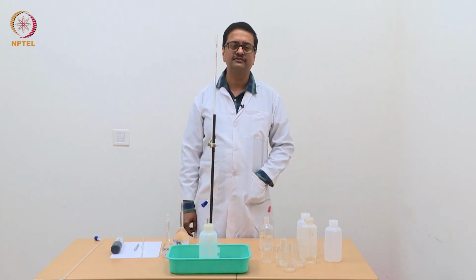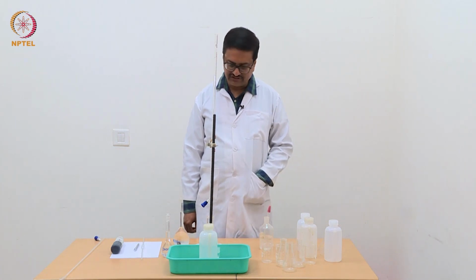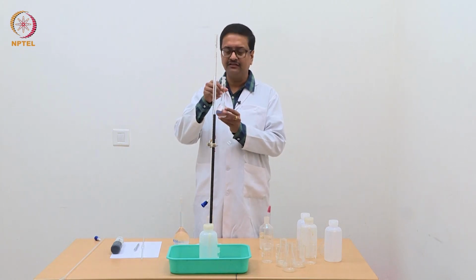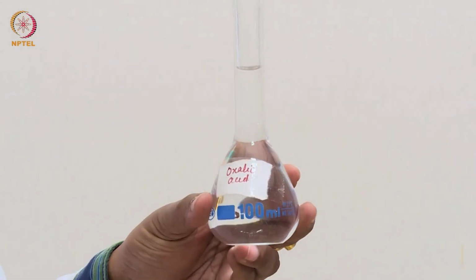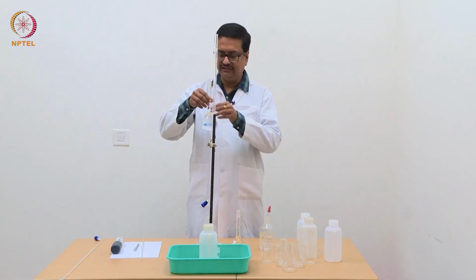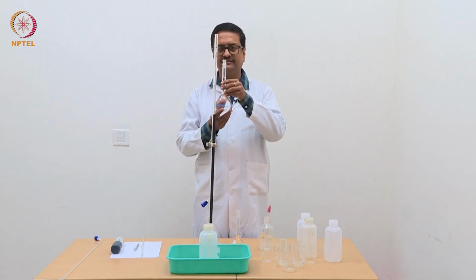In this video we have shown you how to prepare a primary standard solution of oxalic acid, which I am going to use in this experiment to standardize the solution of NaOH, a sodium hydroxide solution which is approximately N/10 in strength.